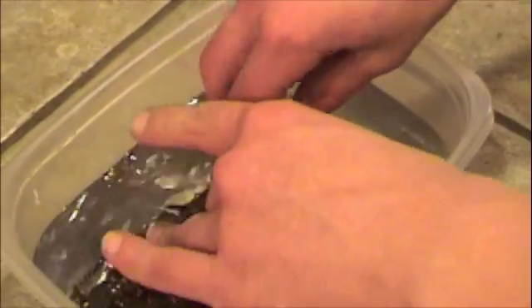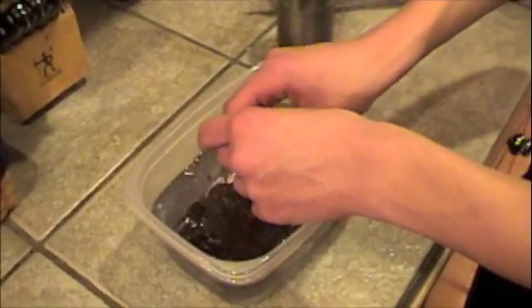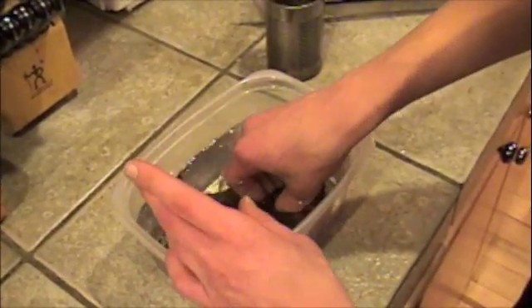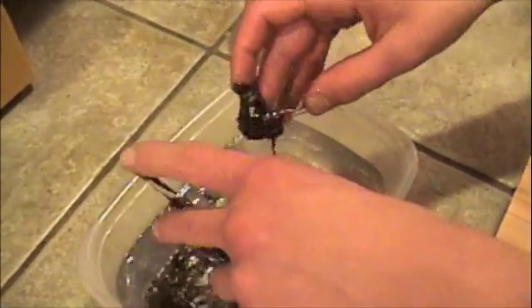That is plastic sulfur. Right now it's brown because of impurities — I had to keep it molten for 30 minutes while the camera was charging, so sulfur dioxide got dissolved in there, making it this nice brown color. But for the most part it's still sulfur — the same chemical we had before, which is pretty unbelievable.